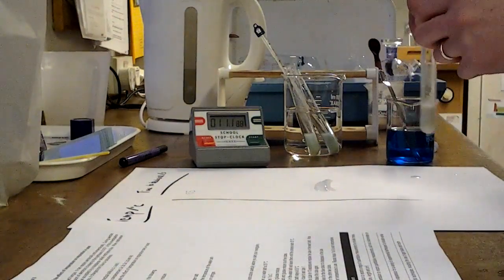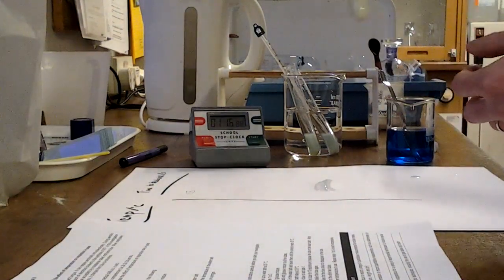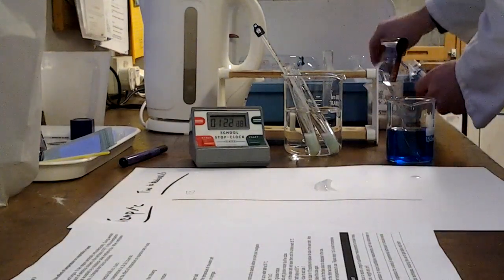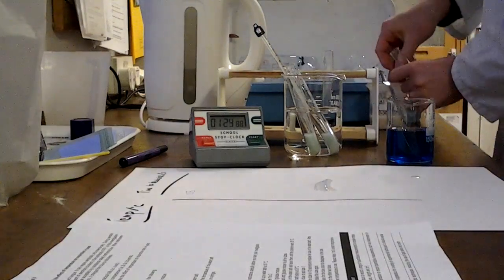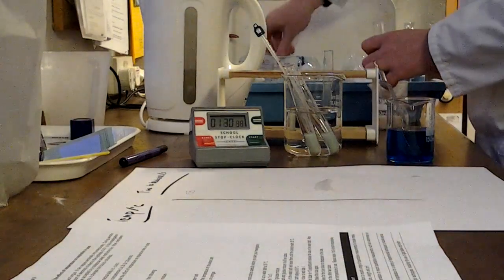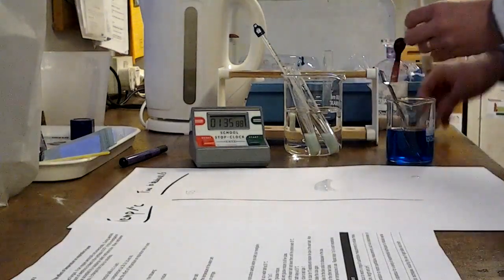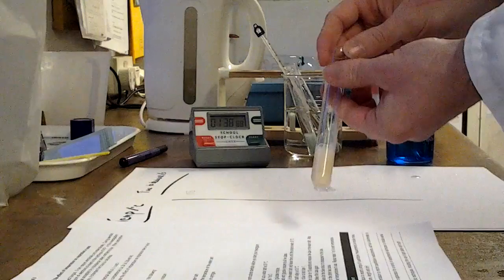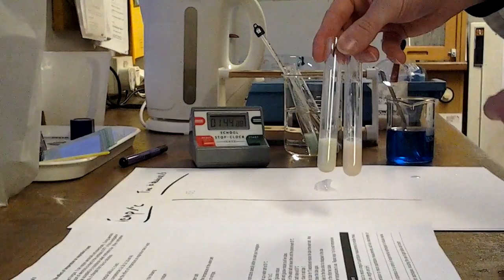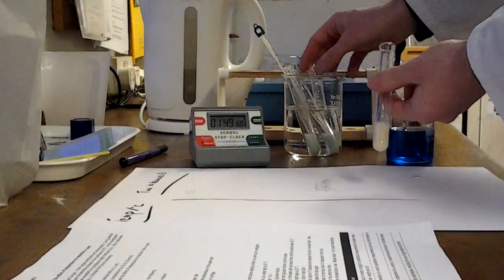The really tricky part with this experiment is deciding when it reaches the end point. Now this one's turned a little bit blue again. Remember the yeast that we started with looked a little bit like this. And if I dilute it with something that's completely clear, so there's no blue colour here at all, just a bit of water, this, I guess, could serve as a reference tube. You'll be able to use this to determine when you think the blue tube has reached the end point, but it's difficult, it is subjective, and you'll need to consider that in your evaluation.